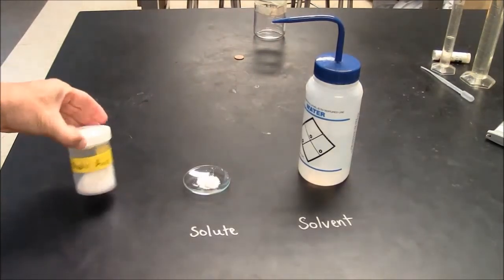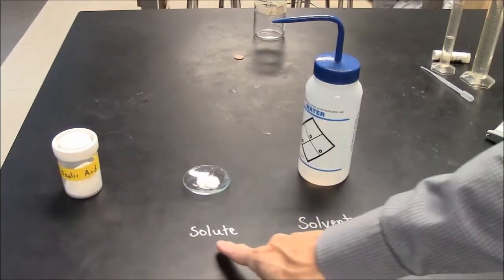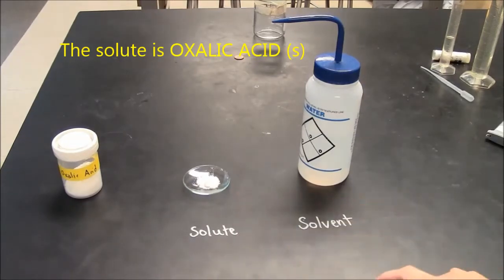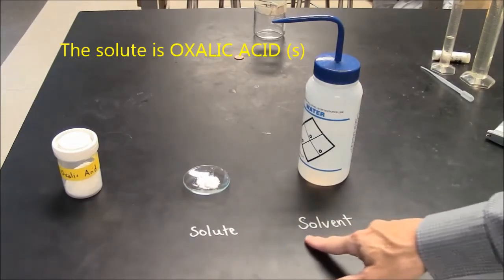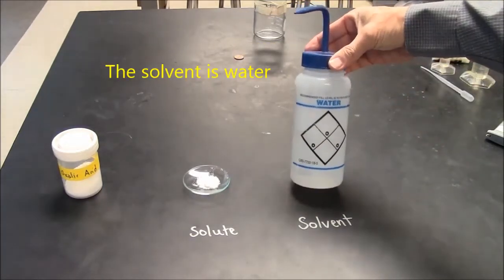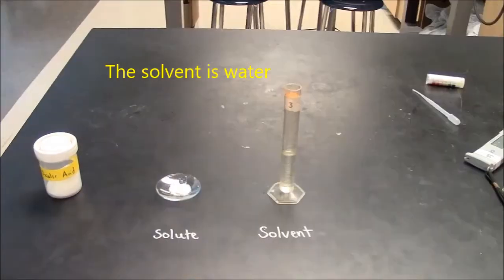In the color by number lab, one of the first things you do is make a solution. Oxalic acid is what you're dissolving. Any solution has 2 components. The substance you're dissolving is called the solute, usually a solid, and the substance you're dissolving it in, usually a liquid, called the solvent. In this case, the solvent is water. The solute is oxalic acid.